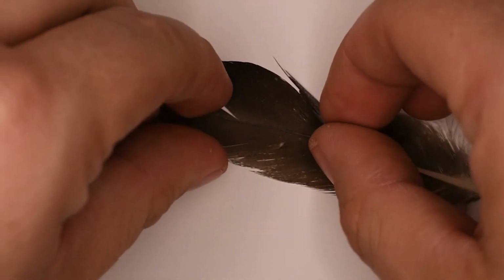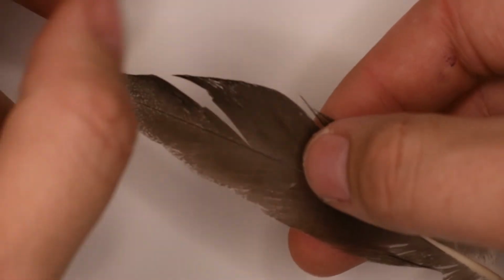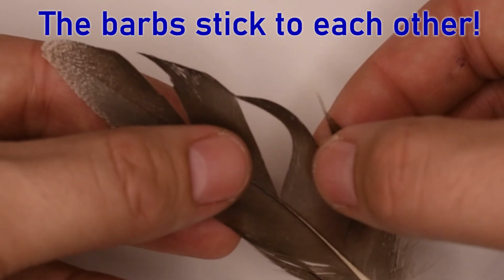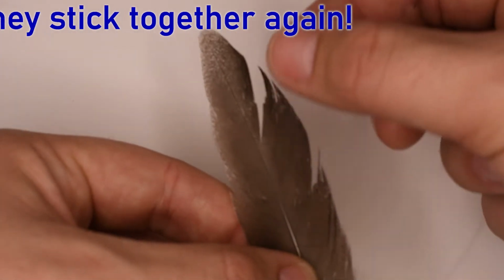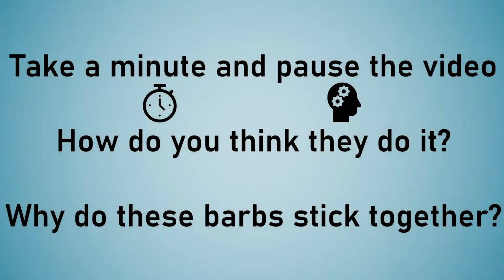If you pick up a contour feather and you try to pull the barbs away from each other, they resist this. But a little more pulling and they separate. But even cooler is if you realign them by rubbing them lightly between your fingers, they stick back together. Why do you think they stick together like this? Why do you think it'd be useful for the barbs to re-stick to each other after being separated?